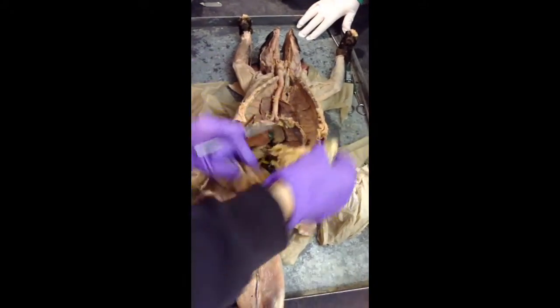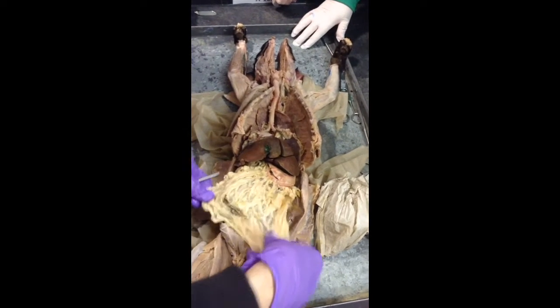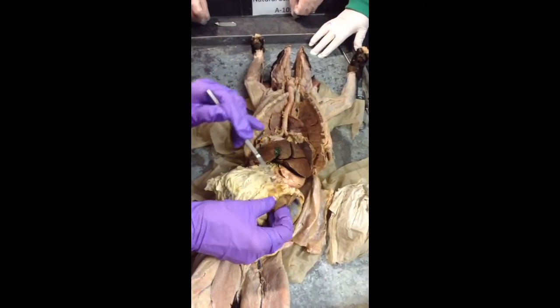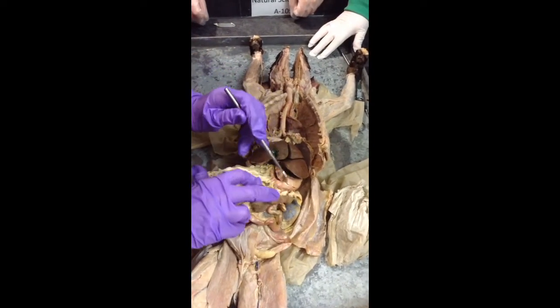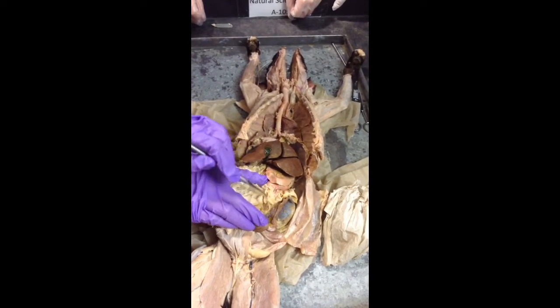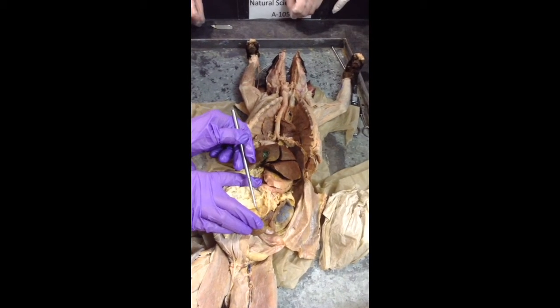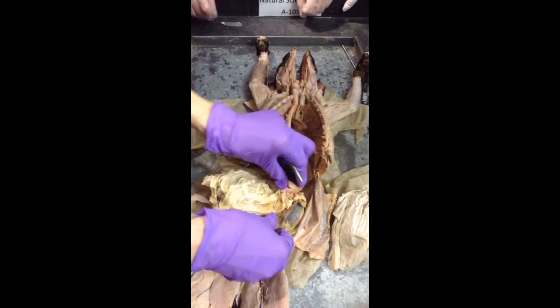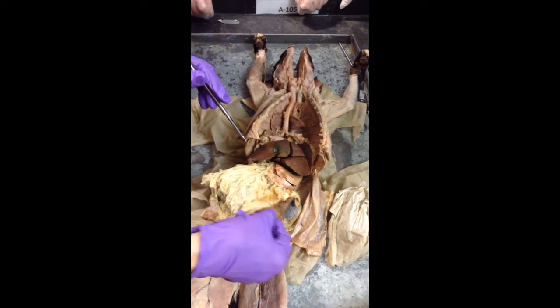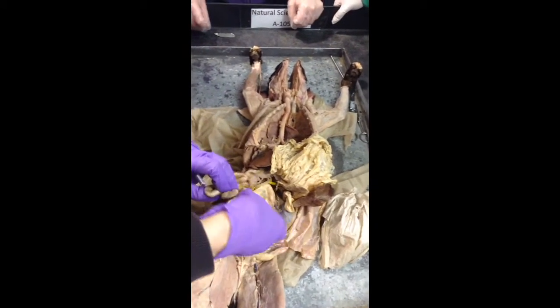And this is this large sheet of fat that lays over and covers the entire intestinal area. And then a portion of that greater omentum that's found between the spleen, this is your spleen, this is your stomach, the portion that's found between those two organs is called the gastrosplenic ligament. So it's just like a continuation of the greater omentum, but it's between the stomach and the spleen, so that's the gastrosplenic ligament.